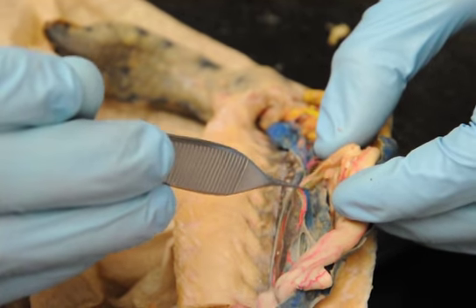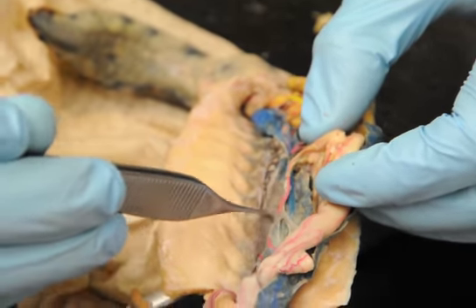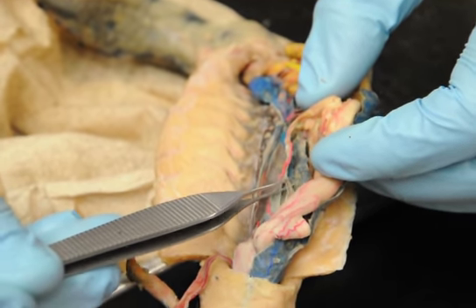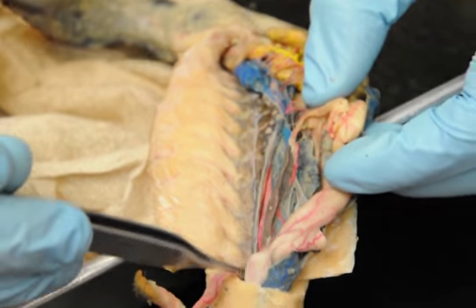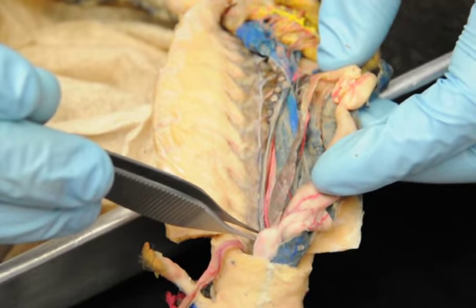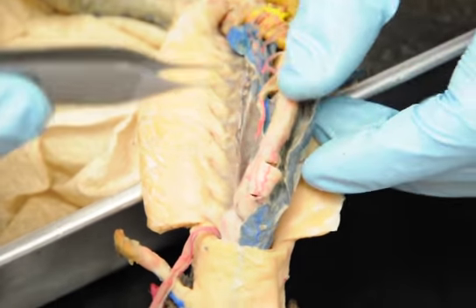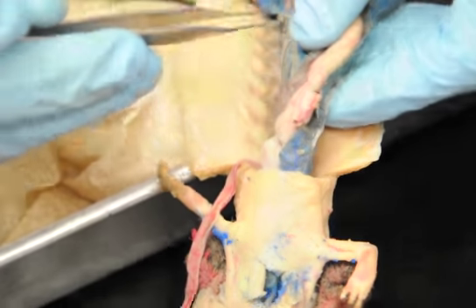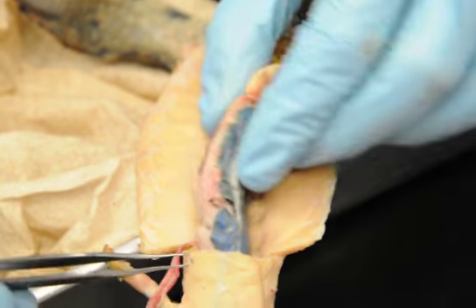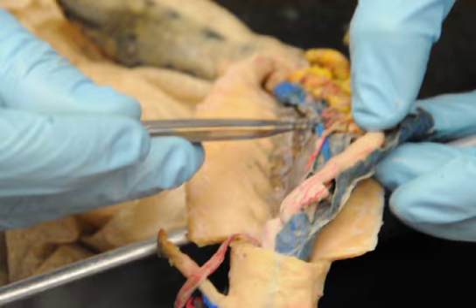So gastrosplenic splits at the spleen, goes into the spleen and becomes splenic, which you can't really see, goes up to the stomach and becomes gastric. So remember that your gastric vein and your gastric artery are actually very separate from each other on the Mudpuppy. My gastric artery in the Mudpuppy is way up here. Gastric vein comes from the spleen and goes to the stomach. Your big blue guy here is the post cava, posterior vena cava. So it goes in way up at the top of the liver, comes out at the bottom.